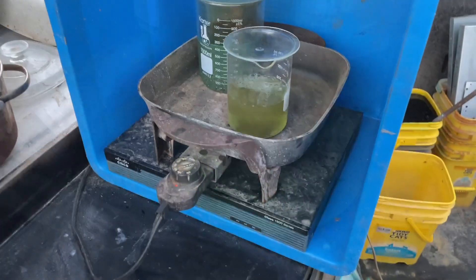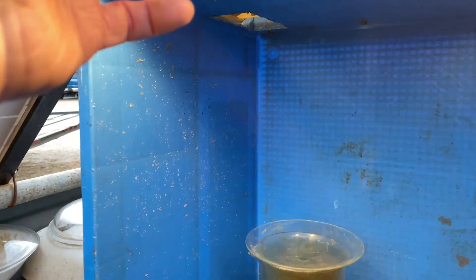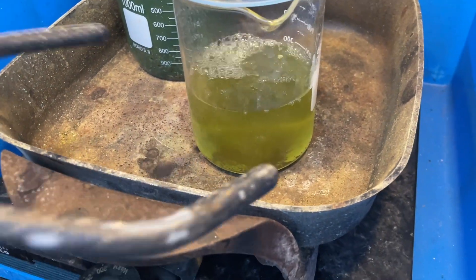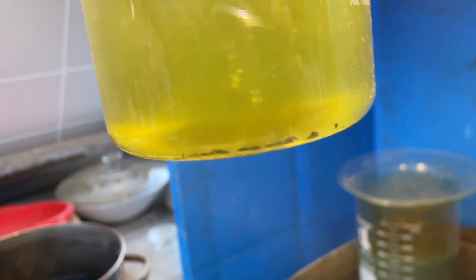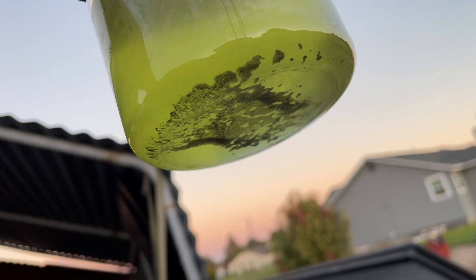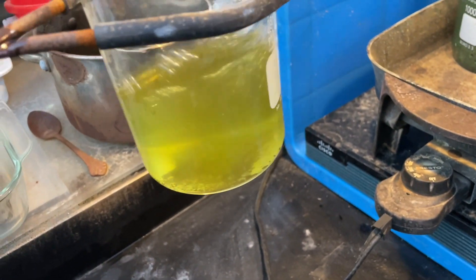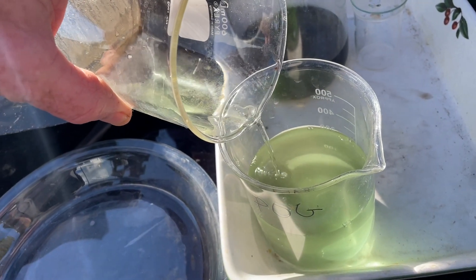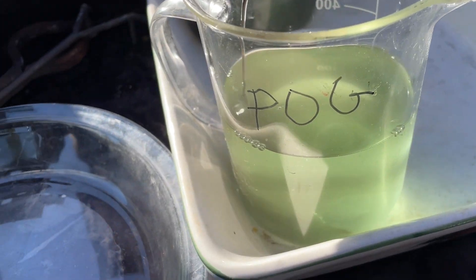I think we can see some gold in there. Look at that — there's a pile in there. A little bit — a couple tenths. I was hoping for about half a gram but you can't always know. Carefully pouring this solution off the gold — don't want to pour off too much gold.